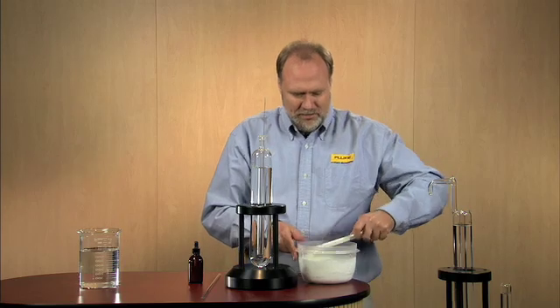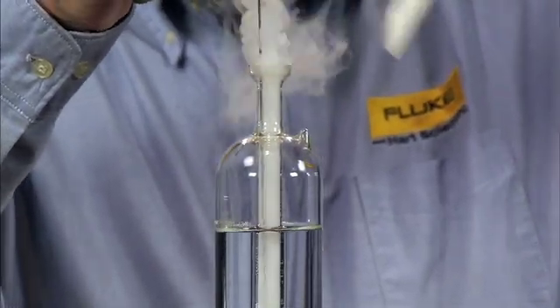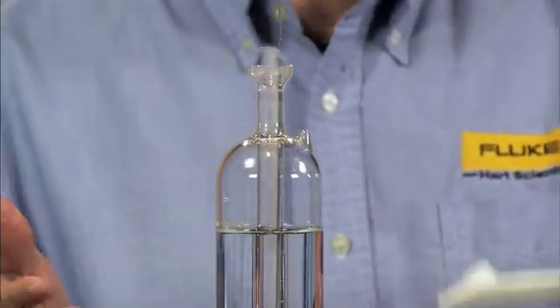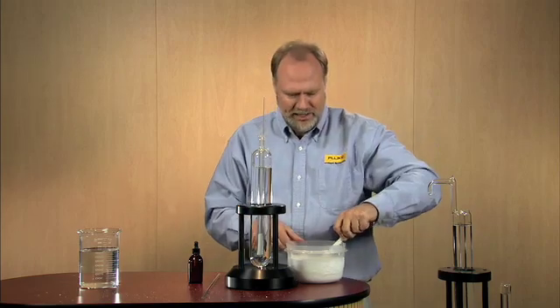Let's try to fill it to the top. Dry ice will spill. That's okay. It evaporates into gas and won't leave a mess in your lab.